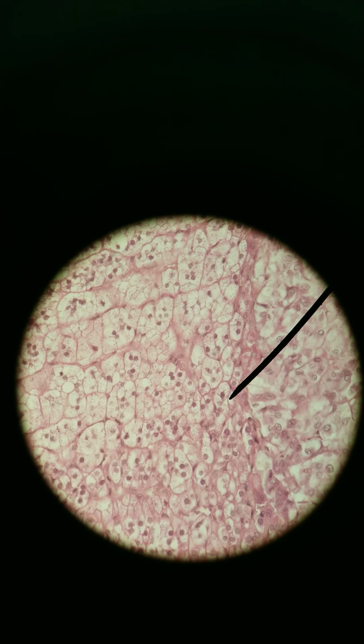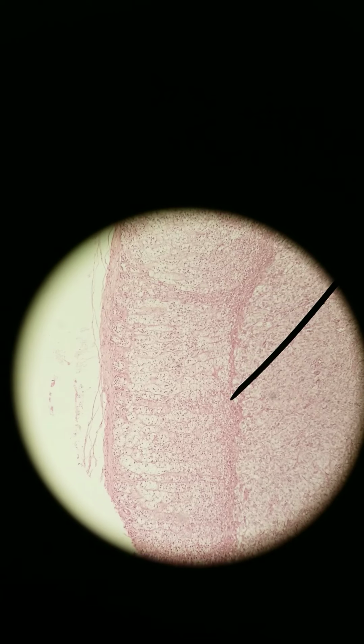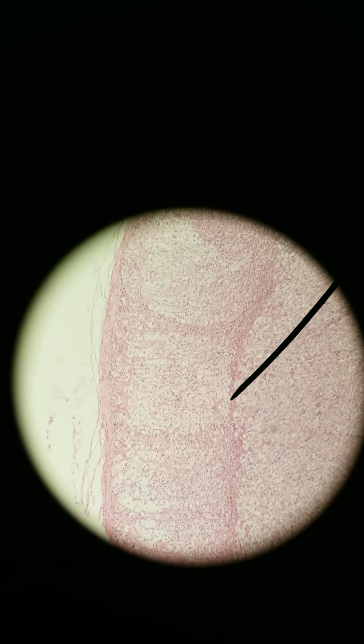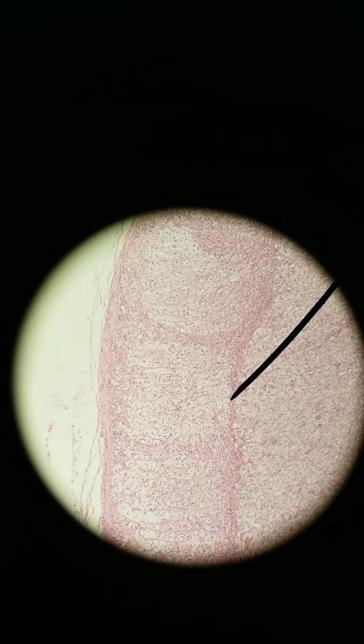This narrow area from here to here where we see the nuclei that are more dense, that's known as the Zona Reticularis. The word reticular, let me go back to 100x, just means network, so it's not really descriptive. But zona reticularis is this narrow group of cells that's bordering the adrenal medulla. The zona reticularis produces androgens. Androgens are male sex hormones.